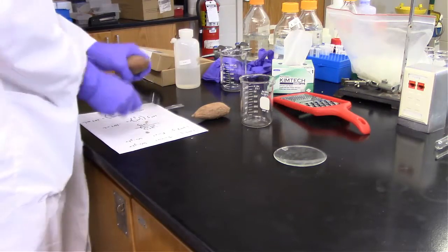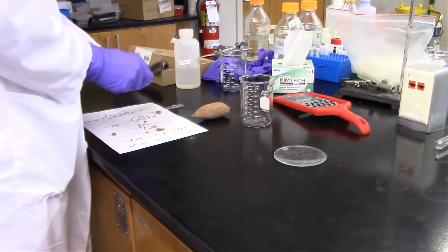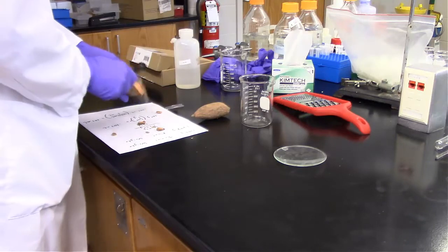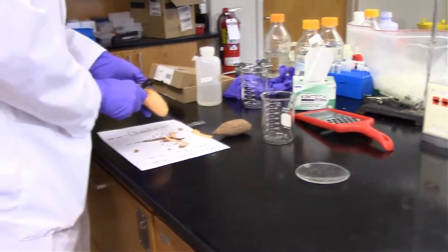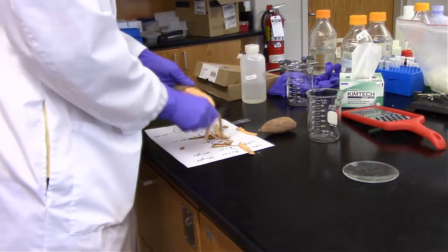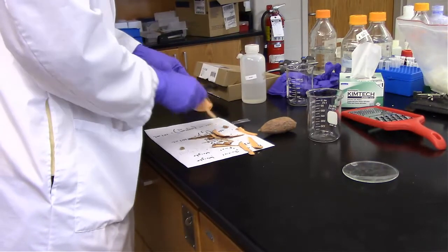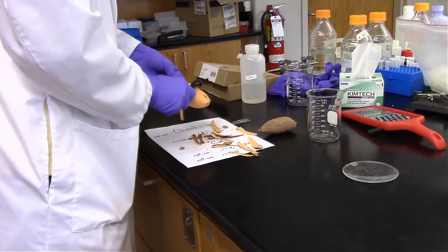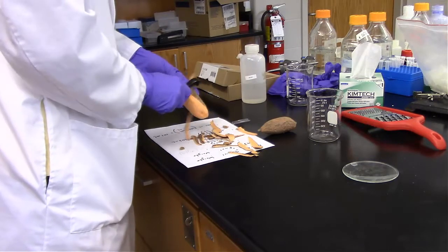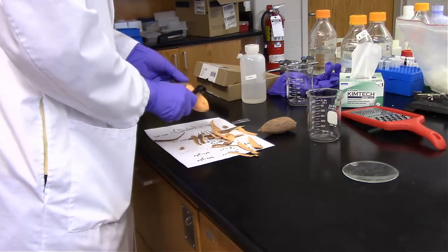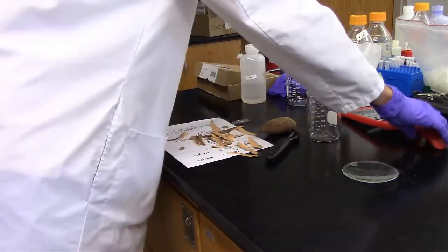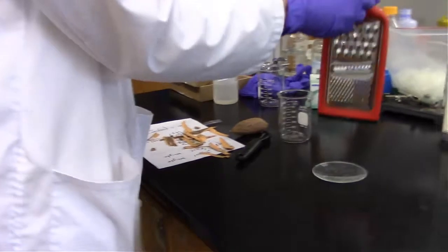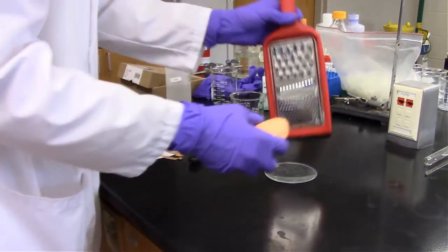As you guys are watching, I decided to go ahead and mute this because honestly it was a little bit embarrassing that I was a little bit disorganized as I was peeling these potatoes. But anyway, we can only do our best. I'm right now peeling the skin off the potato. There is no starch within that skin, so we might as well purify it to a certain extent before we start allowing the starch to separate from the actual potato.